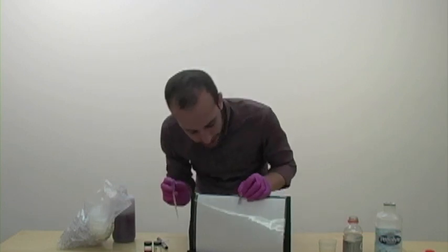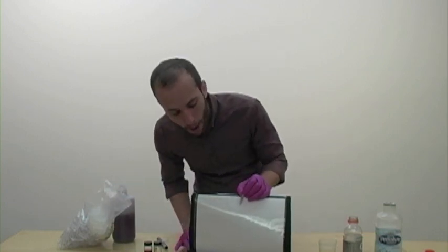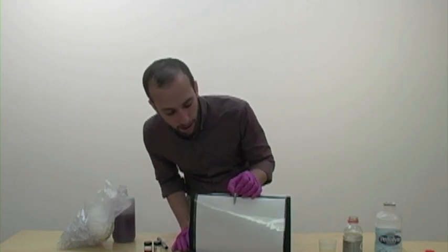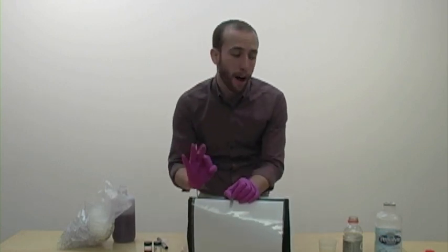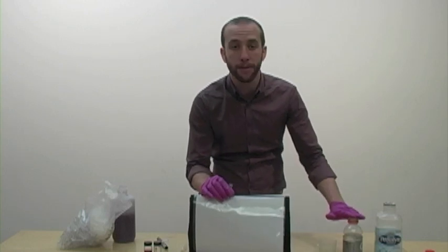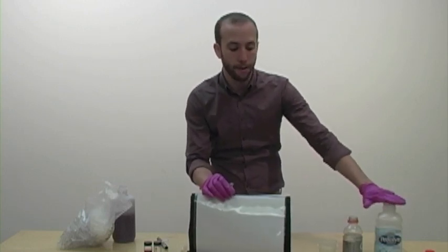So let's see how many it takes for a color change. Two, three. As you can see, with only three drops, we get a very nice distinct dark purple-bluish color. So it only took three drops of the pickle juice, where it took ten drops of the Gatorade and fifteen drops of the Pedialyte.